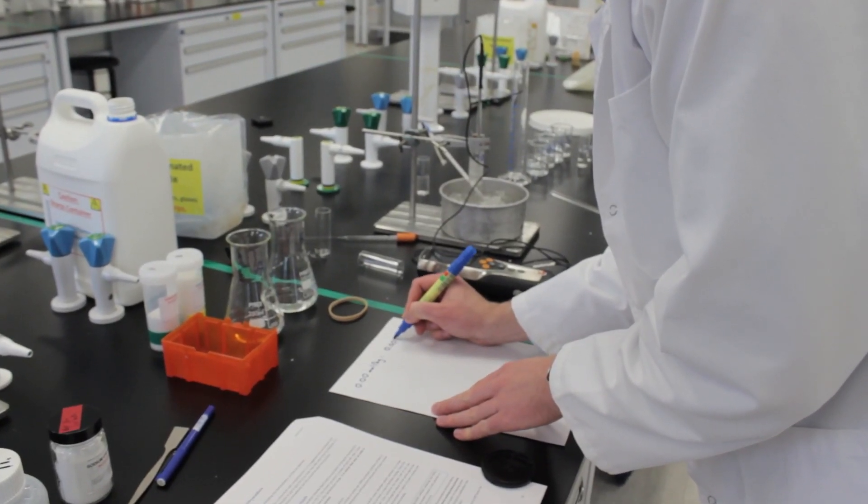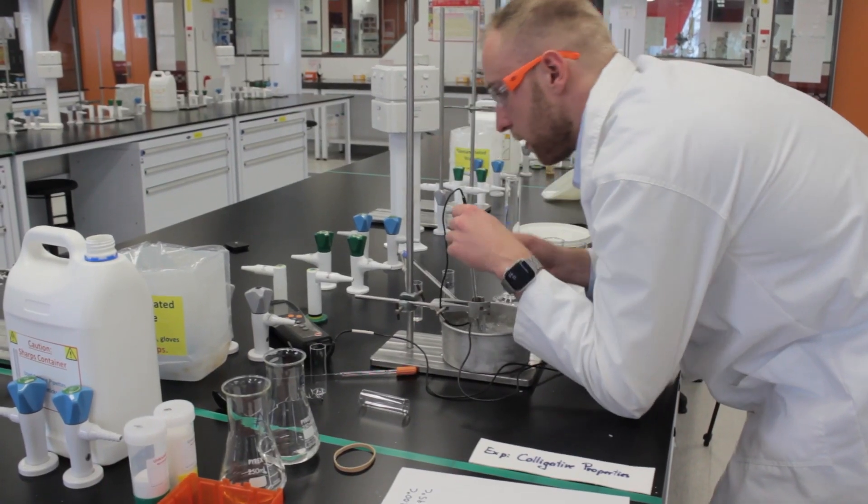Repeat this process for the other three solutions to create a calibration curve for freezing point depression.